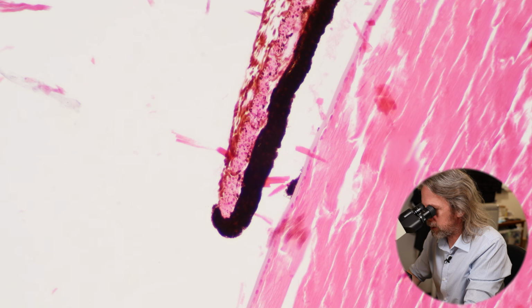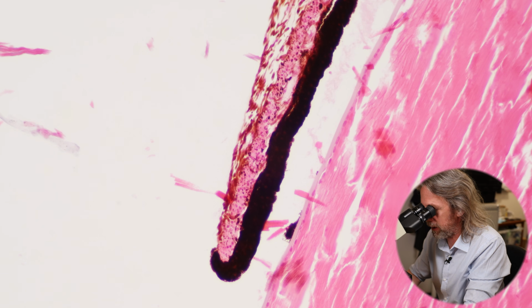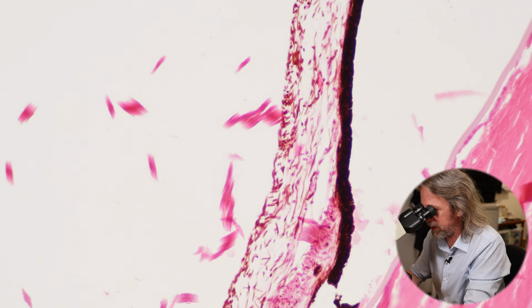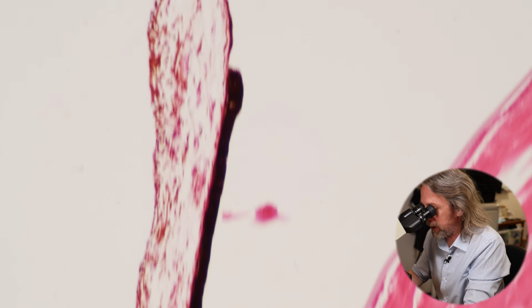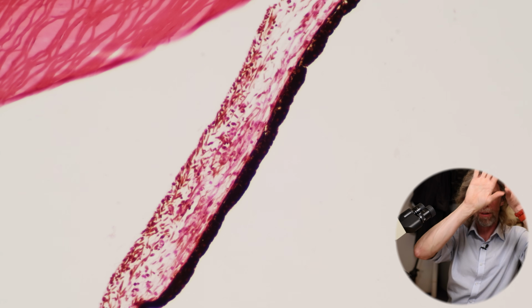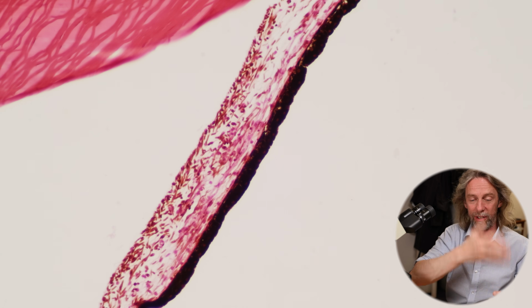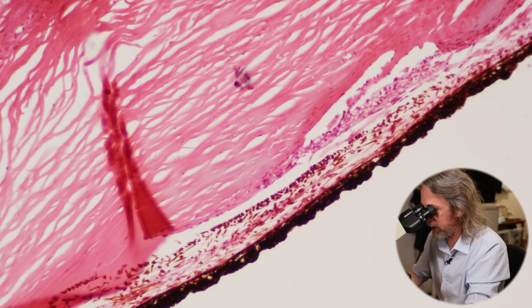Okay, so there's the iris. We can see the connective tissue layer with melanocytes, we can see the sphincter pupillae layer, and we can see the heavily pigmented layer. And actually we're right up against the lens there, but that's probably because this has moved a little bit with preparing the specimen rather than being completely true to life, because we can see a few kinks here, right? It's lost a bit of its shape. Imagine this is a complete disc with a hole in the middle, right? A disc with a hole in the middle is structurally pretty sound, isn't it? Whereas here we're just looking at a section through that, so it looks like a bit of a wafty, thin bit of tissue, which is exactly what we're left with.